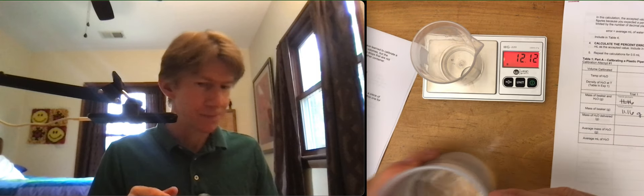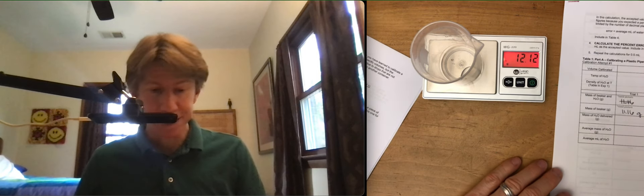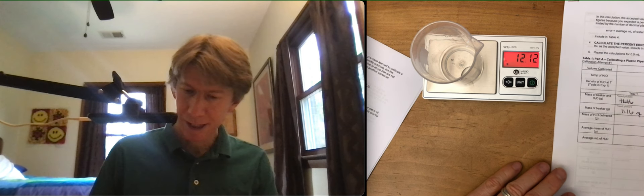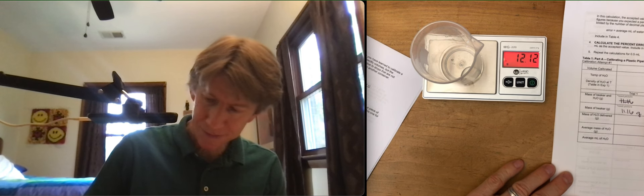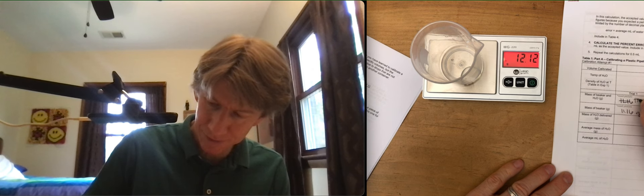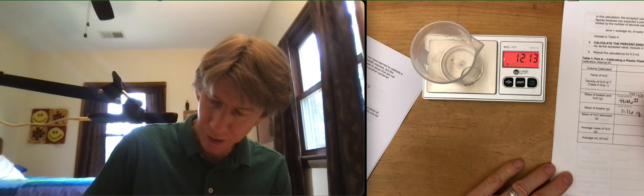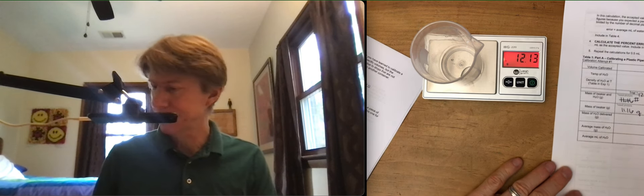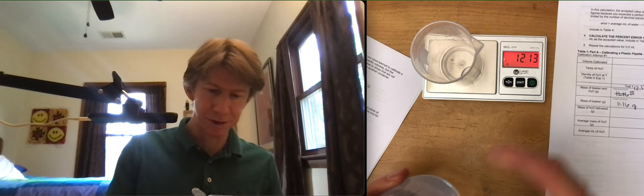But we didn't. And I didn't spill water on it, which is good. I get 12.13 grams. And remember, my table's not as good as yours are going to be.